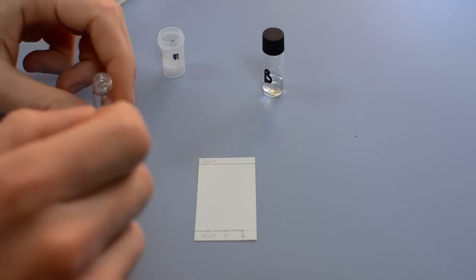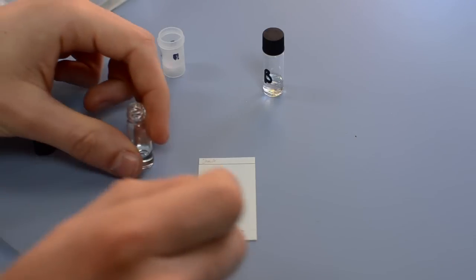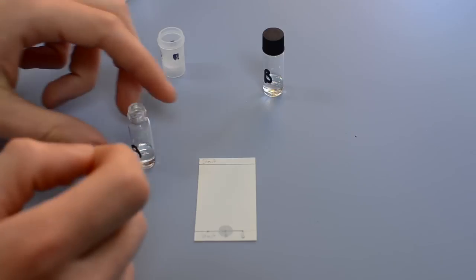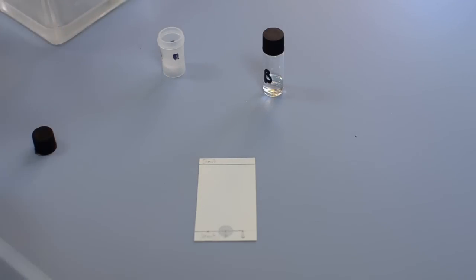This will allow you to compare and examine any progress that has been made. If you are heating your reaction, remove the flask from the heating source briefly while taking the samples to avoid unnecessary evaporation of reagents, products, or solvent.